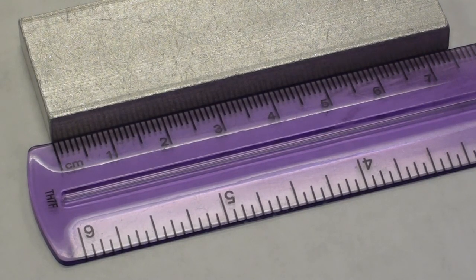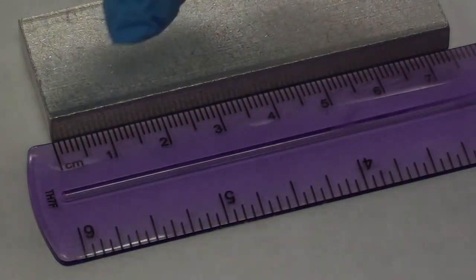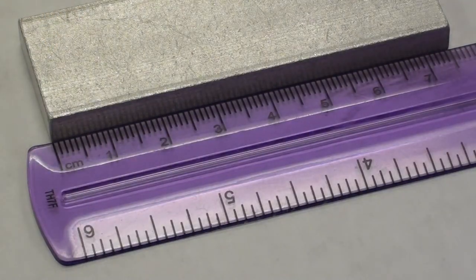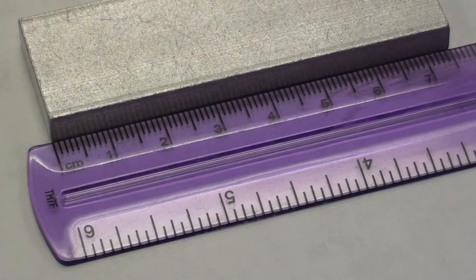Now something to keep in mind, make sure we're using the centimeter side, the metric side of the ruler. Do not use the inch side. All right, excellent.